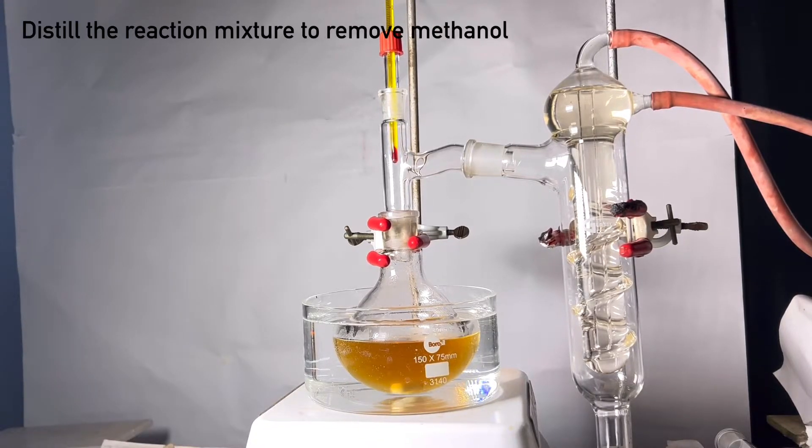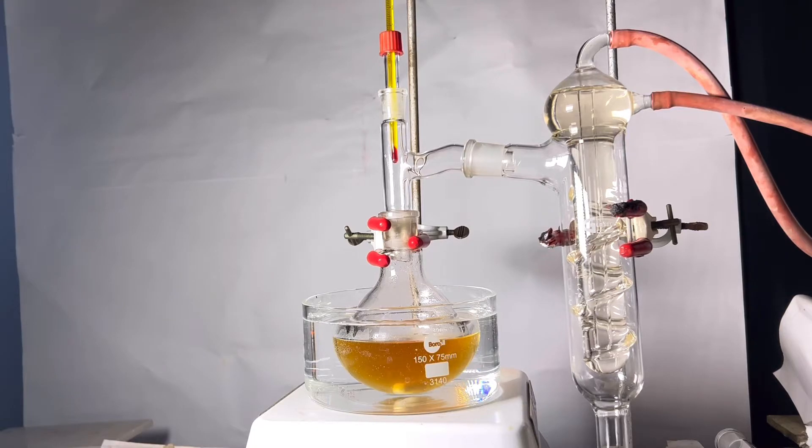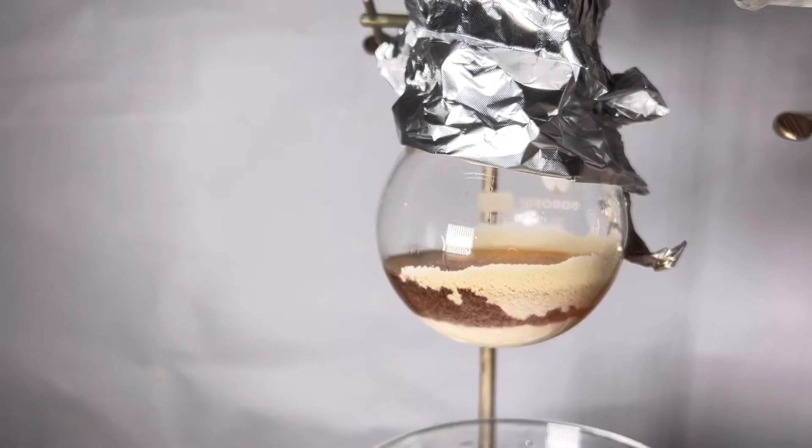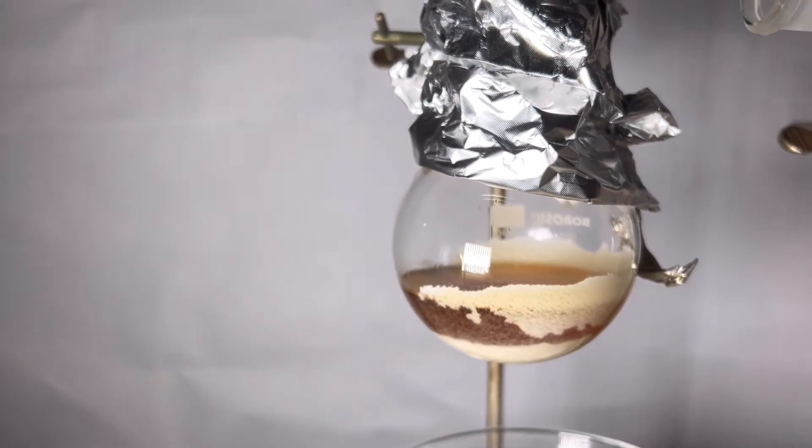The filtrate is taken up in a distilling flask. It was set up for simple distillation with a water bath. This is to remove all the excess methanol. This is what remains after distilling methanol.